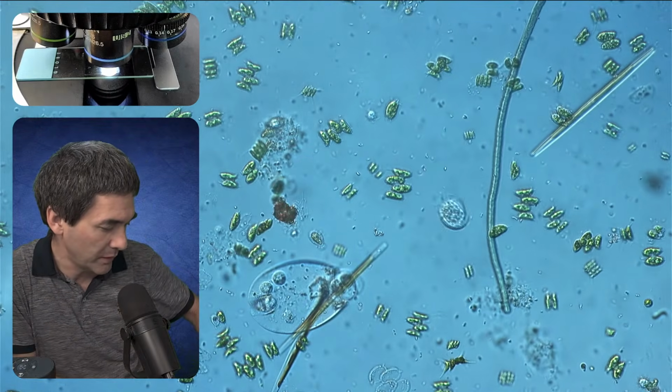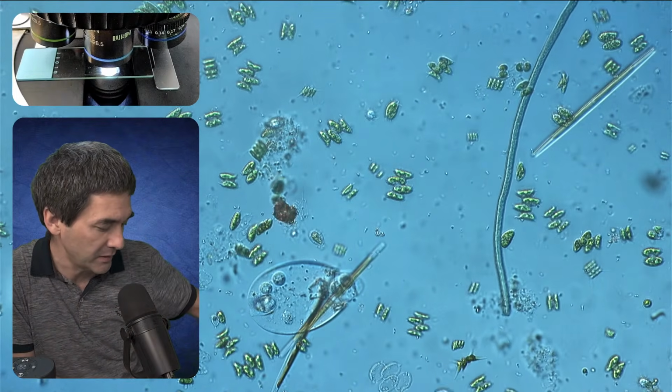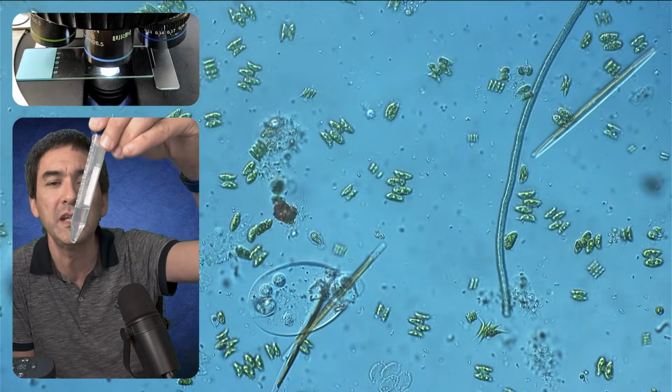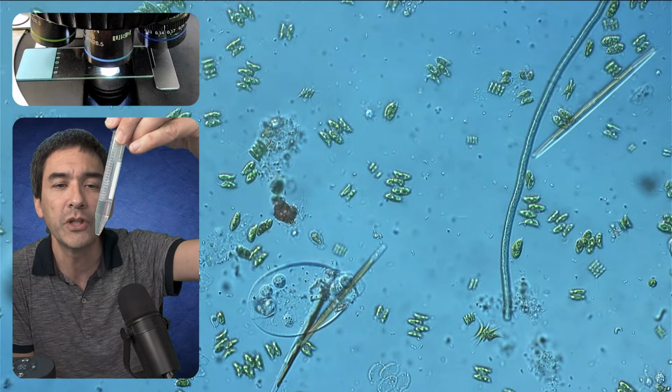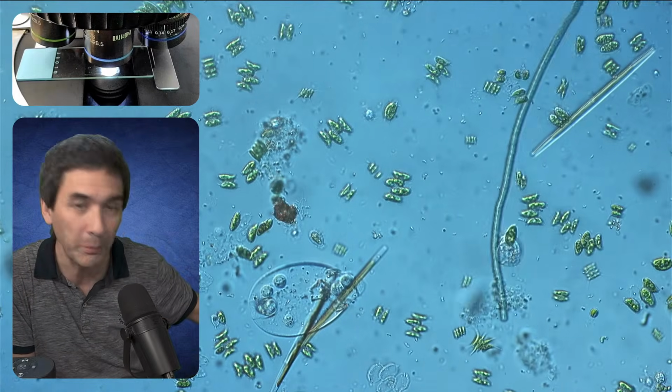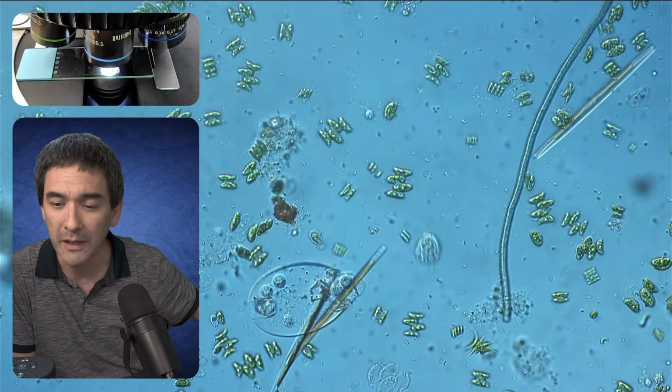However, I also caught a couple of larvae. I think it might be some kind of mosquito larvae or related, 3 of them, which I would also like to put under the stereo microscope, and we're gonna take it from there.